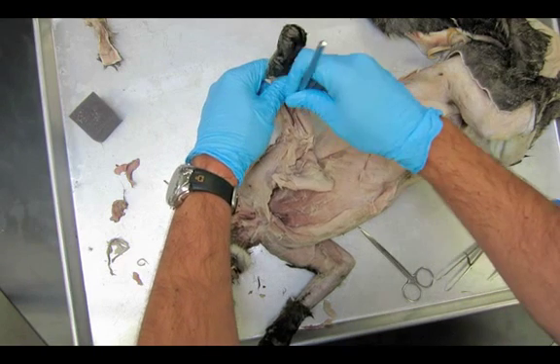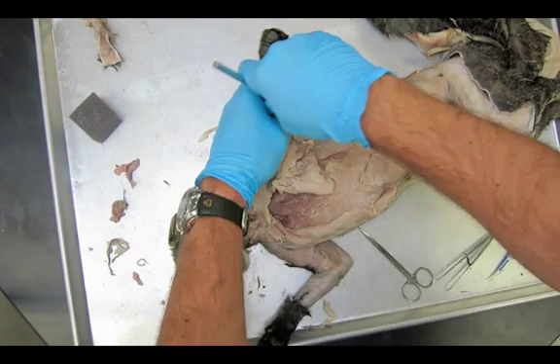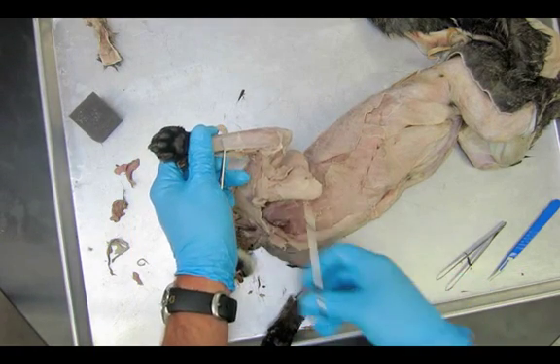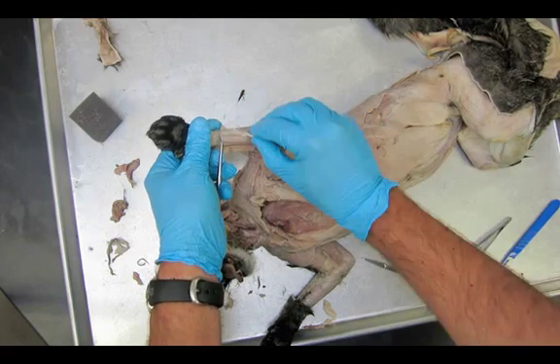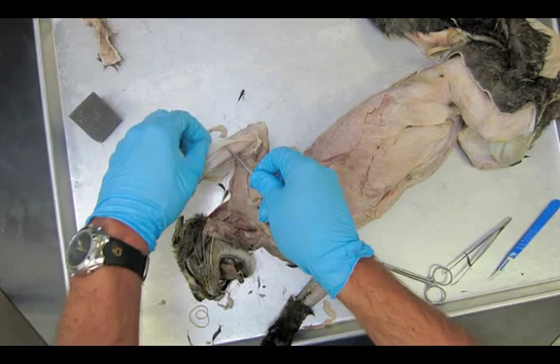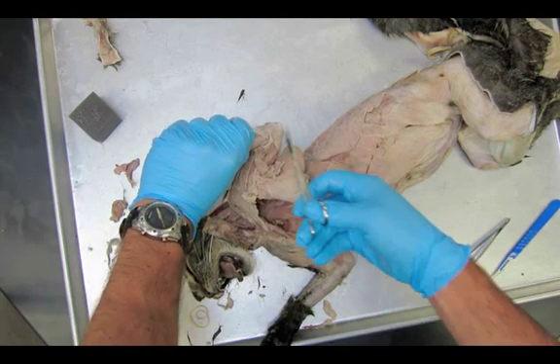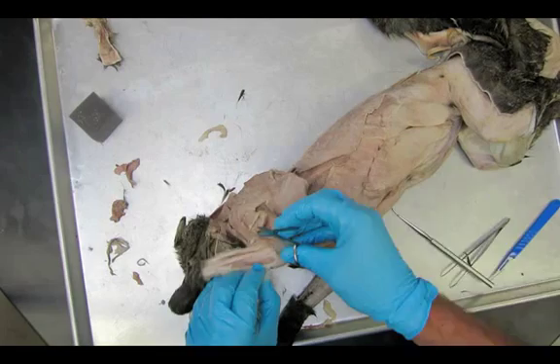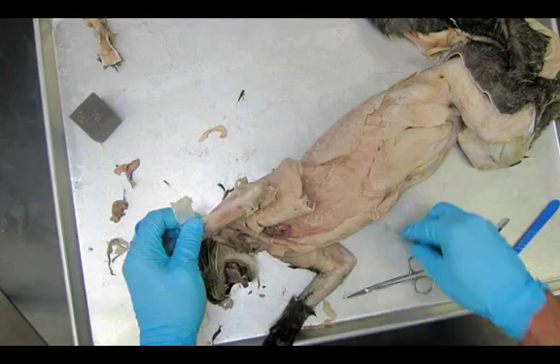If you can't see the line, you may need to remove more tissue. You can see this clear fascia that needs to be removed — just cut through the fascia on the surface, being careful not to cut a muscle. Once that's removed, we should have a pretty clear view of the palmaris longus and even the flexor carpi ulnaris on the other side.